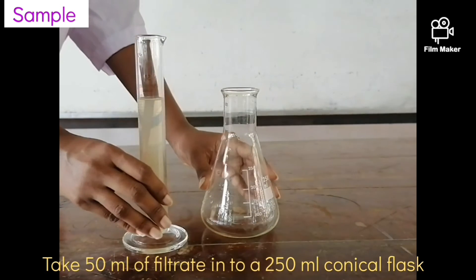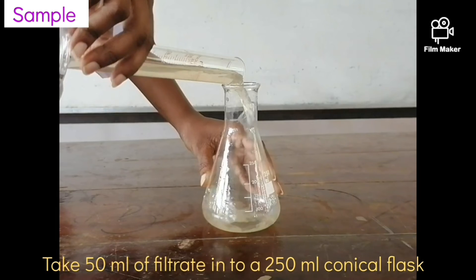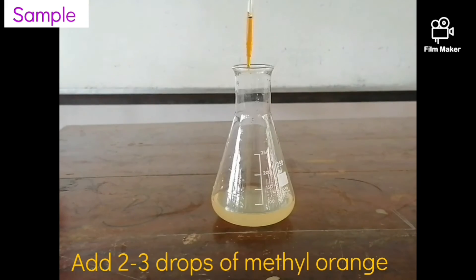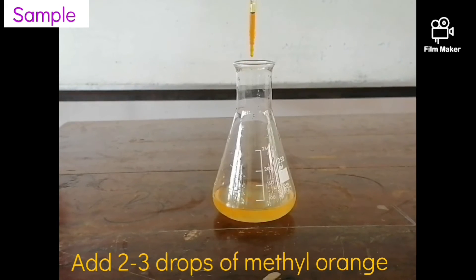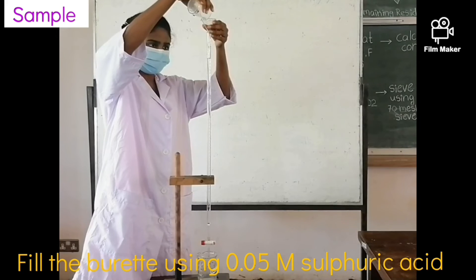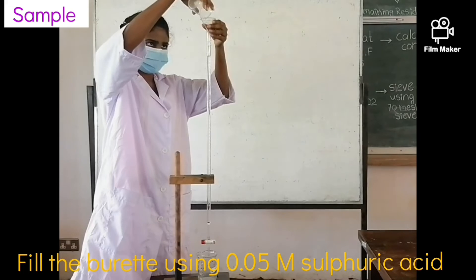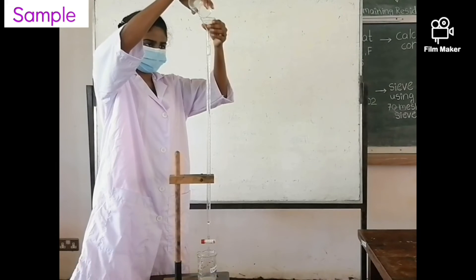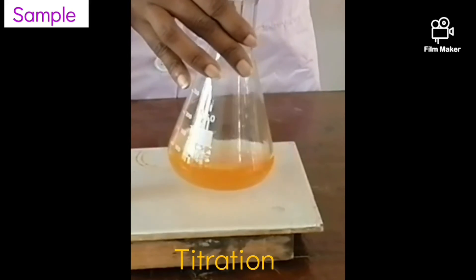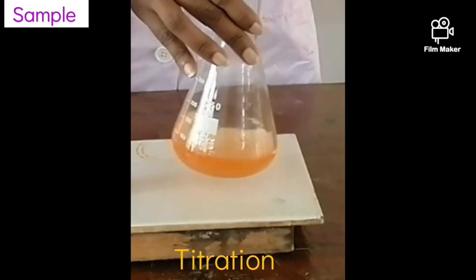After filtration, pipette out 50 milliliters of filtrate into a 250 milliliter conical flask. Add 2–3 drops of methyl orange indicator. Then titrate the solution against 0.05M sulfuric acid until the orange-yellow color of the mixture turns pink. Take the end-point burette reading.